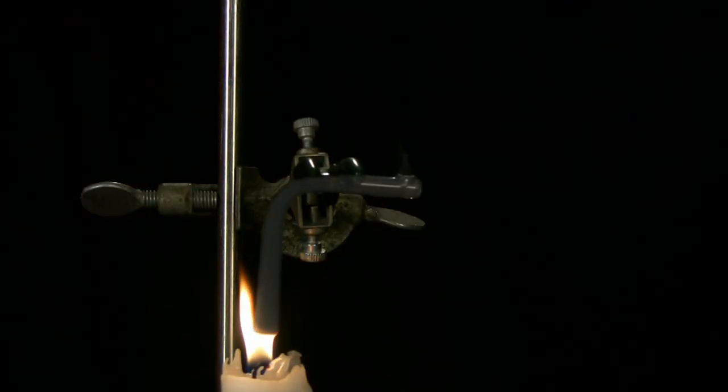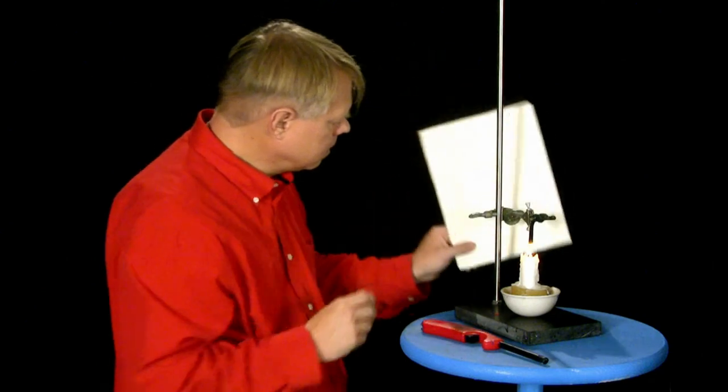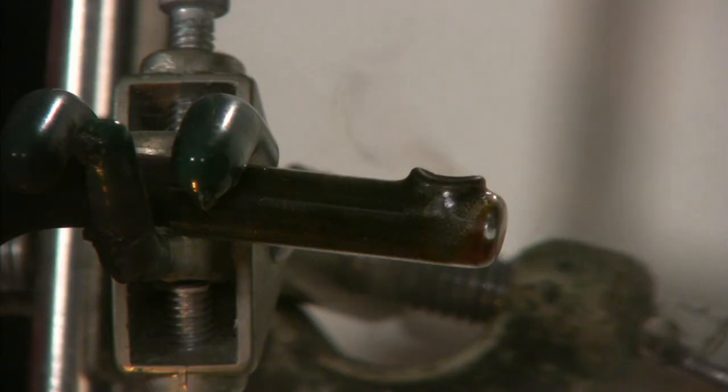I have arranged the glass tube so as just to dip into this luminous part, as in our first experiment, only higher. You see the result.